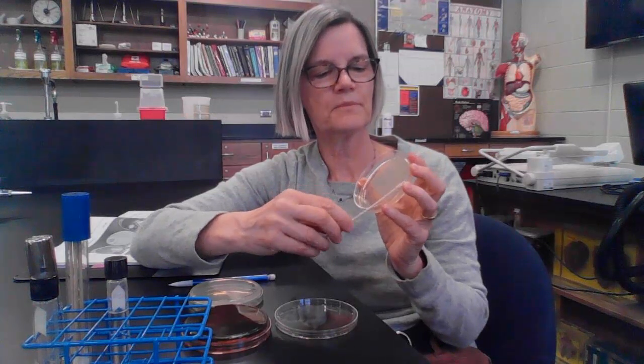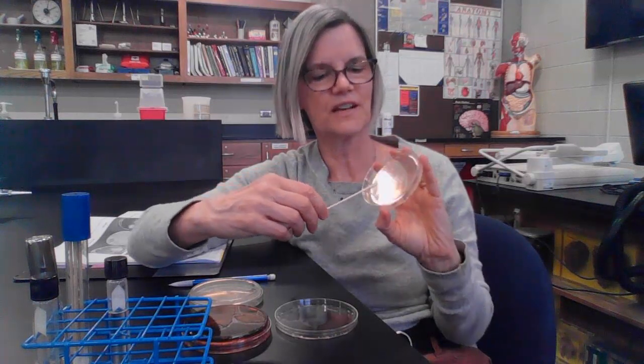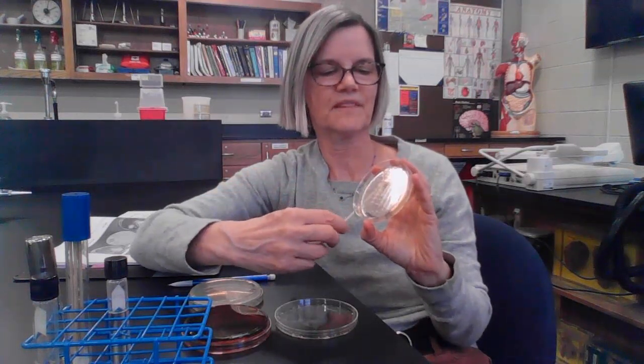And so I'm going to take the surface of my hand with my wet swab, and I'm just going to go back and forth and swab the surface of my hand. And then I'm going to pick up the bottom of the plate. Now, if I pick up the bottom of the plate, I can start to spread this on here. If I had my bottom down, I'd have to pick up the lid, put it down, pick up this, do a little twist. It's a lot more manipulations, and when you're doing a lot of plates, it turns out to be a big deal. So I'm going to pick up the bottom of the plate, start at the top, and swab from top to bottom. And hopefully I'm spreading some bacteria all over this plate. I'm going to turn it 90 degrees, and swab again.